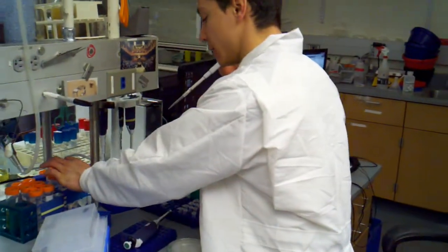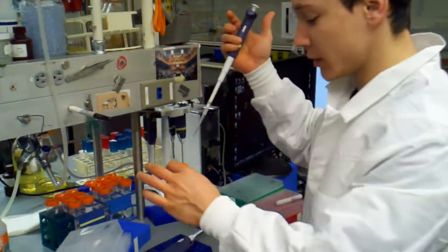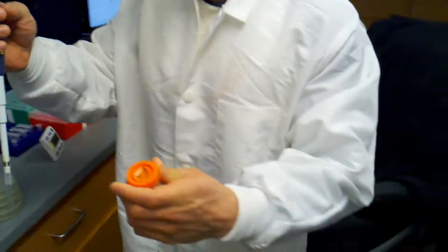So I'm good to go here. I have a 50ml culture, that's why I'm using 500 microliters here. Get my sterile 20% arabinose.